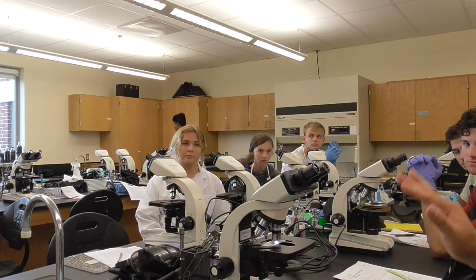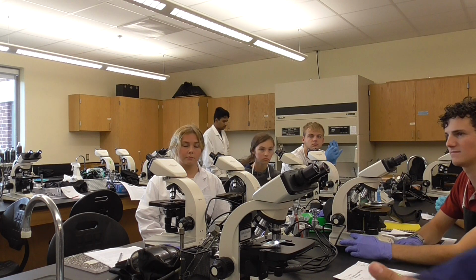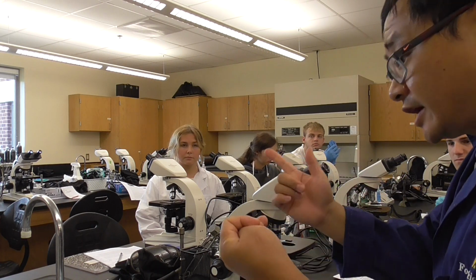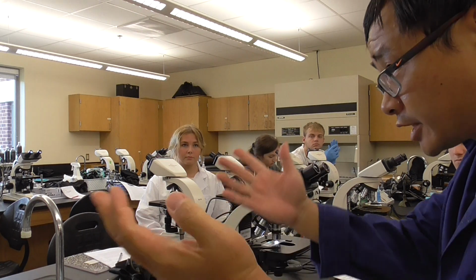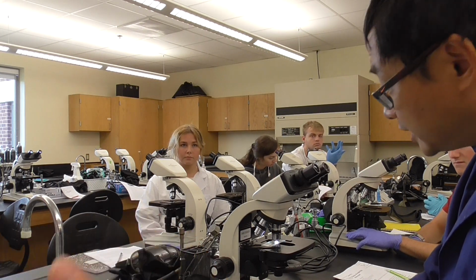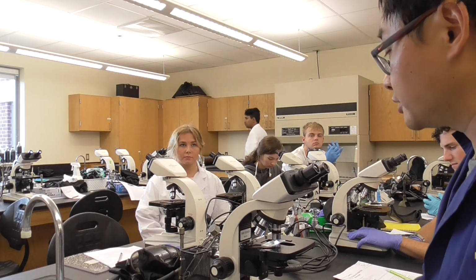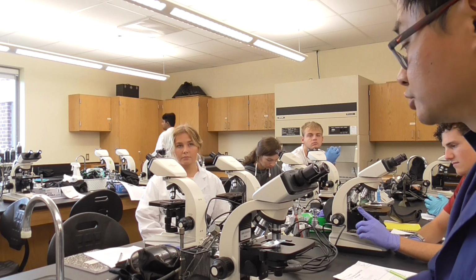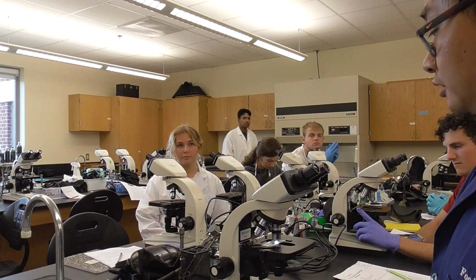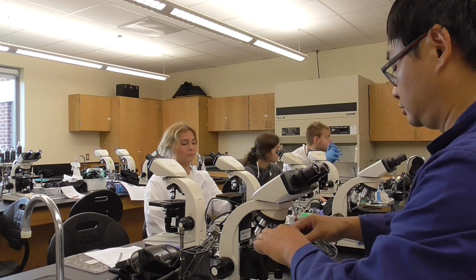Okay, so that's going to be your practice. I hope you get familiar with the microscope and how we're going to use it, because we will do simple stain on Thursday, Gram stain next Tuesday, and endospore stain next week. And then we have a quiz, which means a group project to identify an unknown. In the next five labs, we are all going to use a microscope. And I would love for you, at the end of the day, no matter which grade you get, to come out of this classroom very comfortable and with big confidence using the microscope. You will be the master of this. That's the goal, so go ahead and practice. If you don't know how to do it, you can ask the TA, he will help you. Okay?